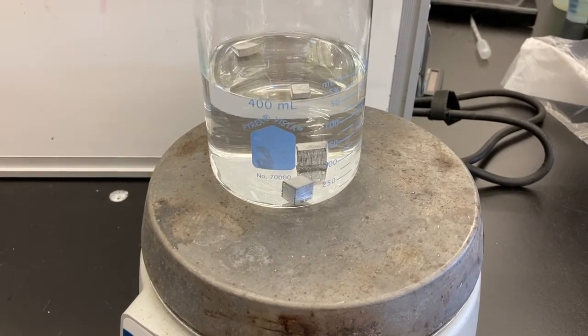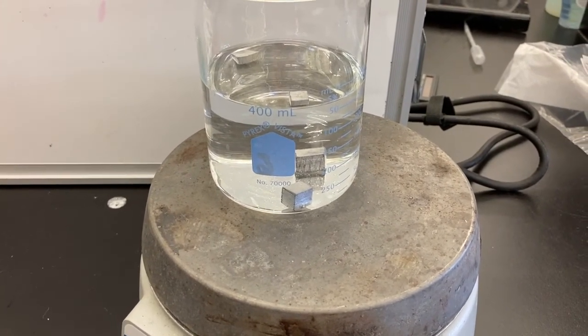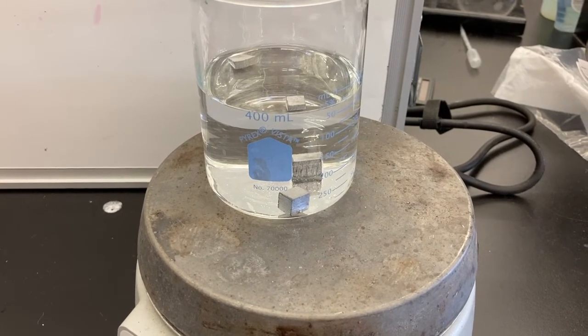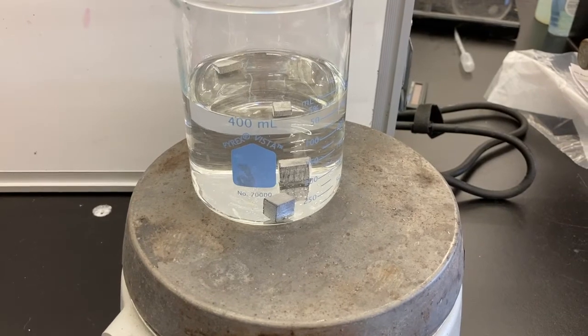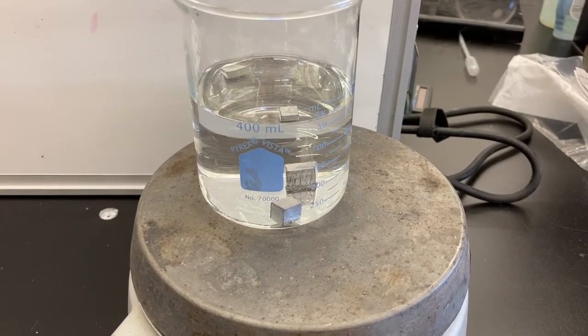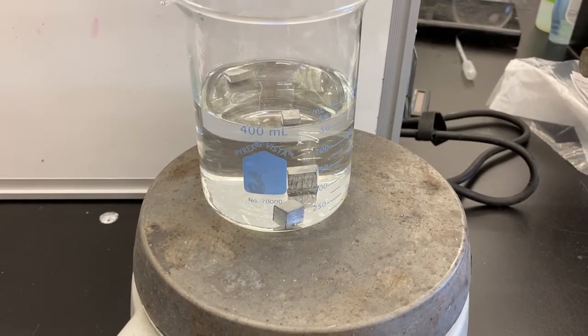You're aiming for this to reach a boiling temperature. So once it gets to a boil, you're going to adjust the temperature on the hot plate but keep it heating for a good 10 minutes before you do the next part of the experiment.